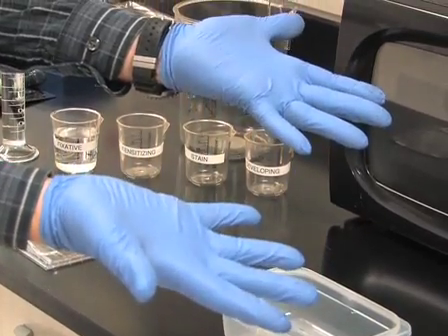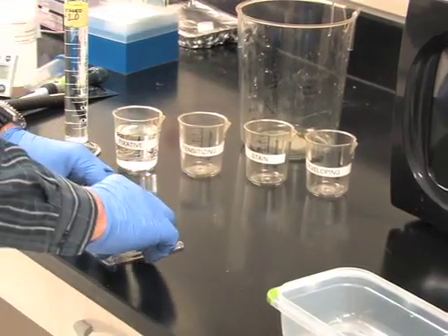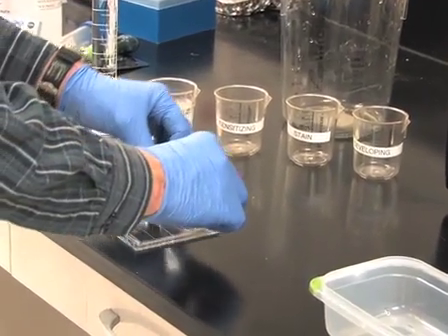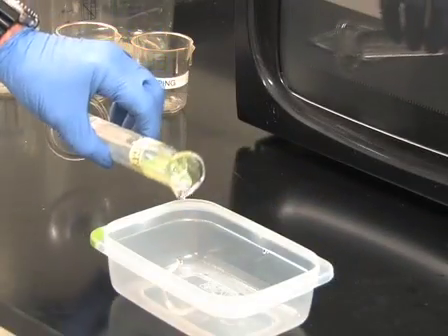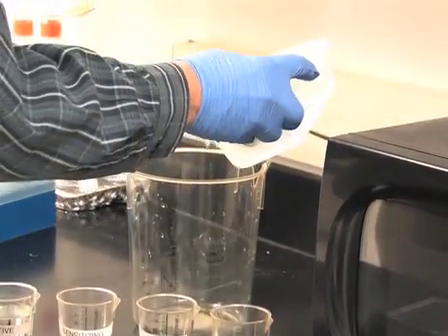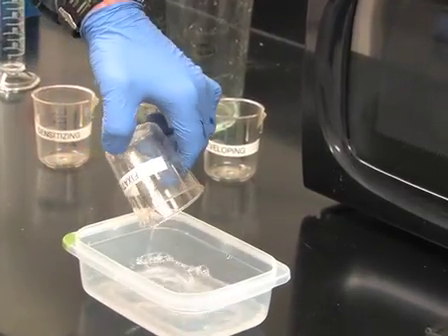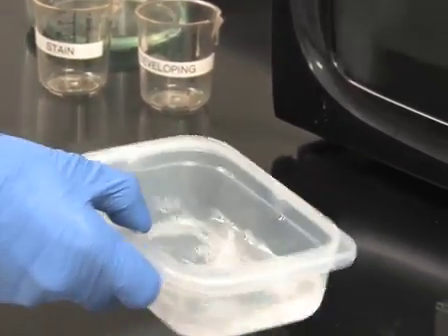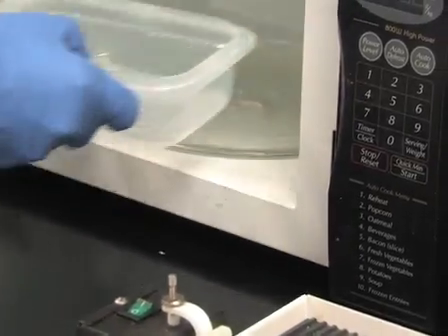In this case, we will be using an Invitrogen pre-cast mini gel. Before beginning silver staining, make sure to wear gloves at all times to avoid fingerprint contamination. Place the gel in a microwave-safe tray with 100ml reagent-grade water, briefly rinse, and then pour off the water. Next, add 100ml of fixative composed of 40% ethanol and 10% acetic acid in high purity water, and microwave for 30 seconds.